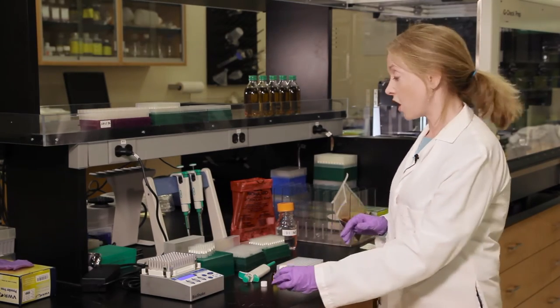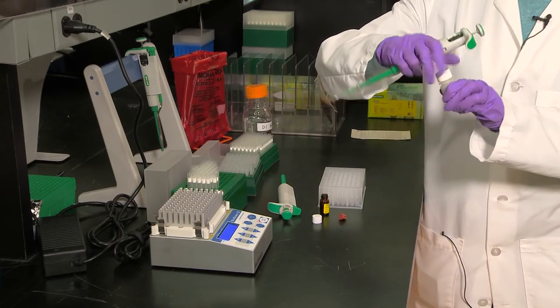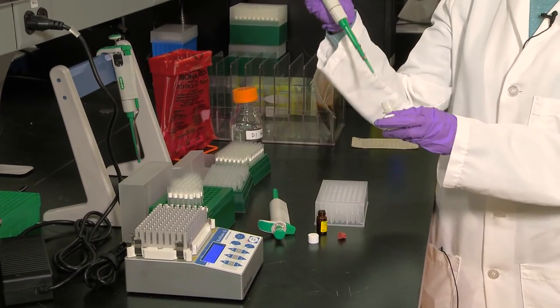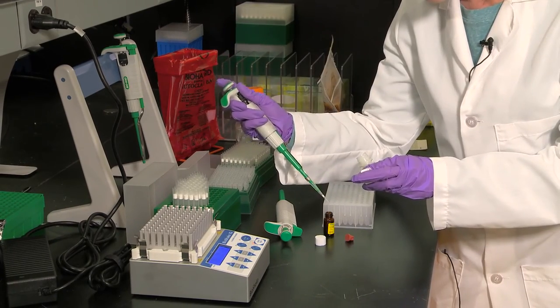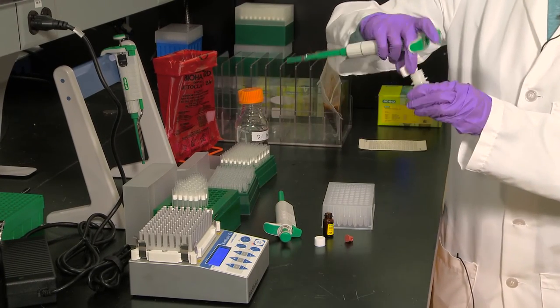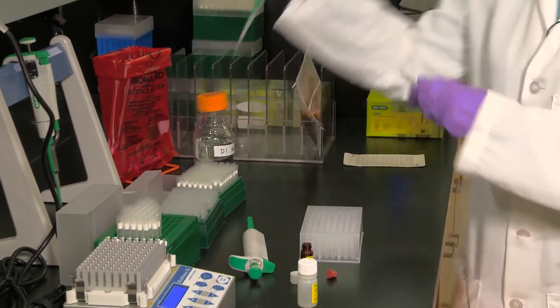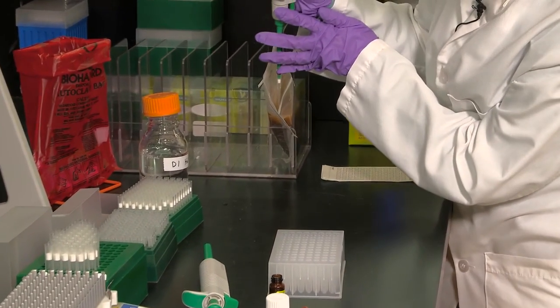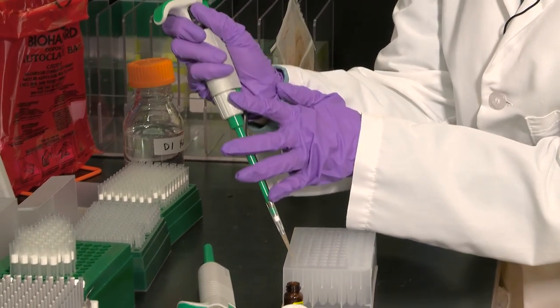For each sample to be analyzed, prepare 10 microliters of your activated solution from G2 into a well of your deep well plate. Then add your sample — 100 microliters — with just the tip going into the bag to avoid contamination into your deep well plate.